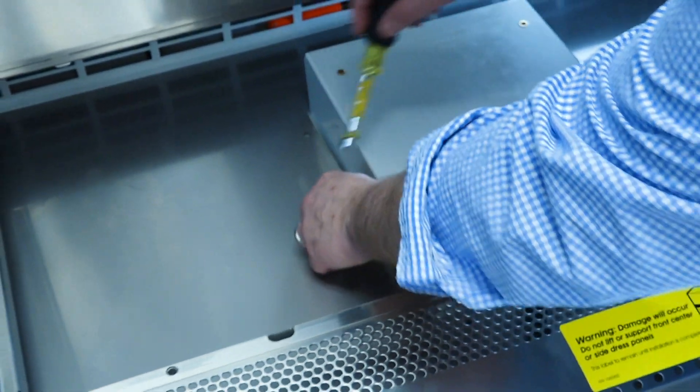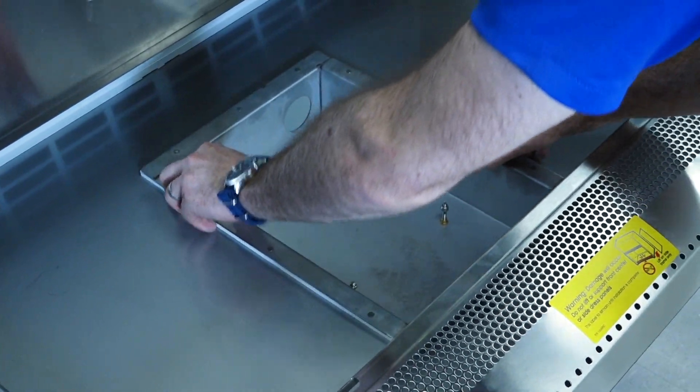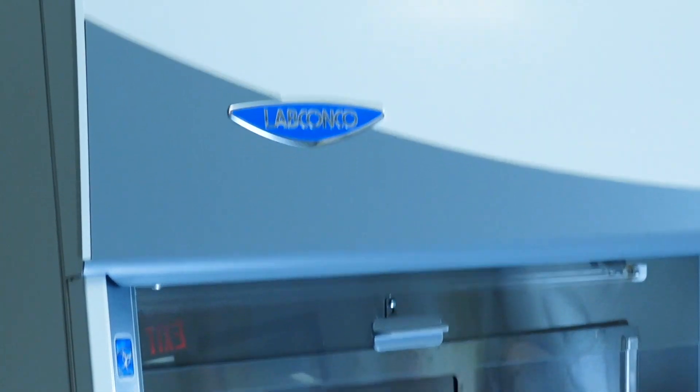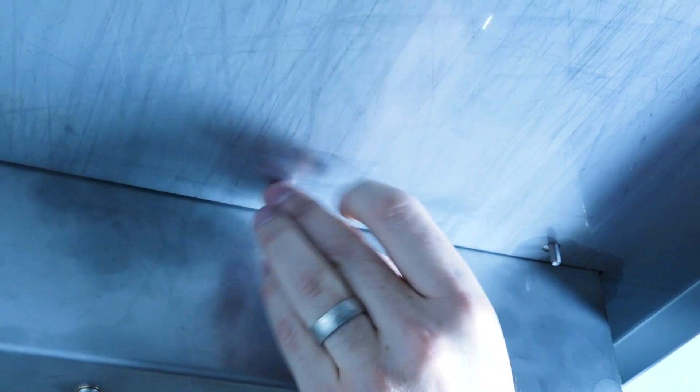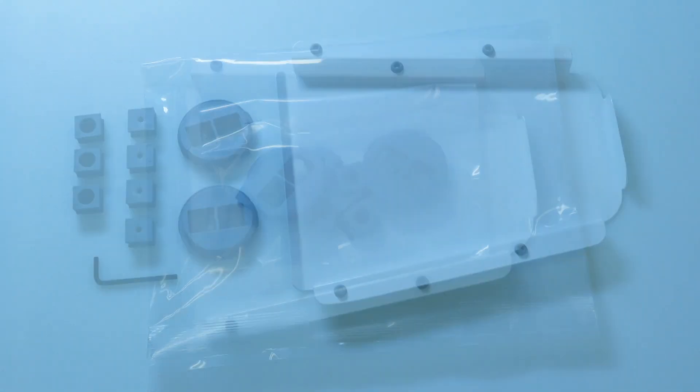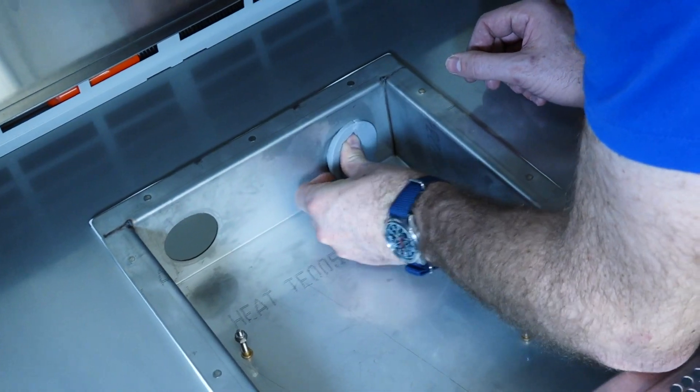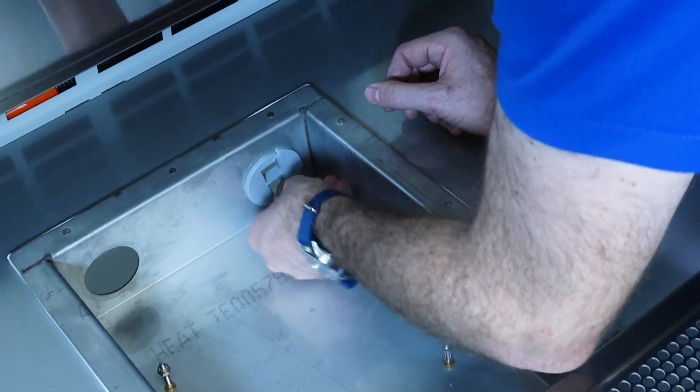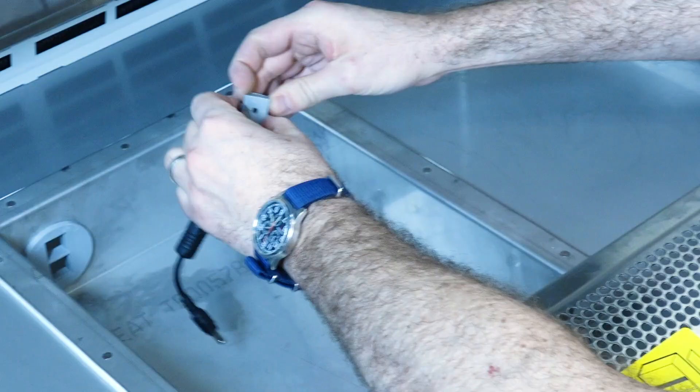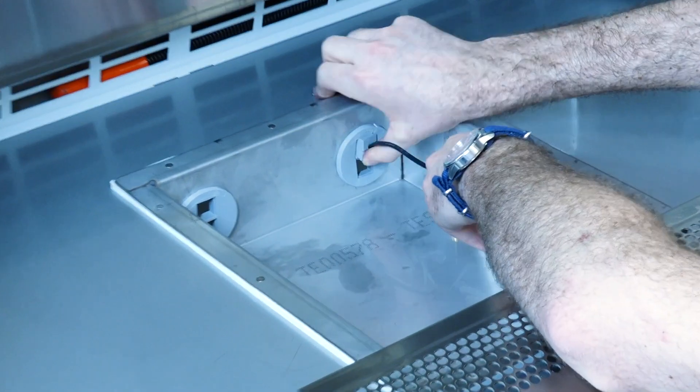The Rebel Microscope support system can now be assembled. Begin by placing the white scope gasket onto the scope sump's weld studs. Drop the sump into the work surface, then secure with 12 nuts from underneath the biosafety cabinet. Continue by installing both pass-through ports into the rear wall of the scope sump.